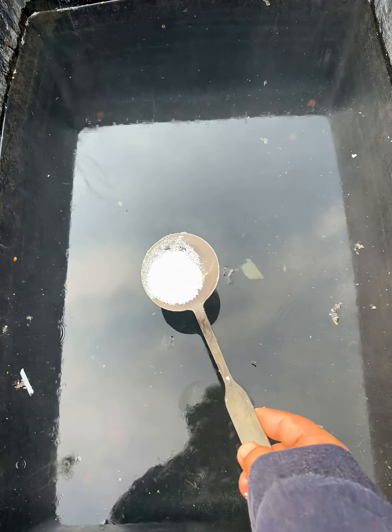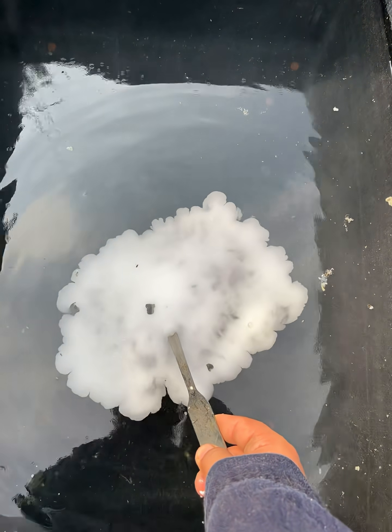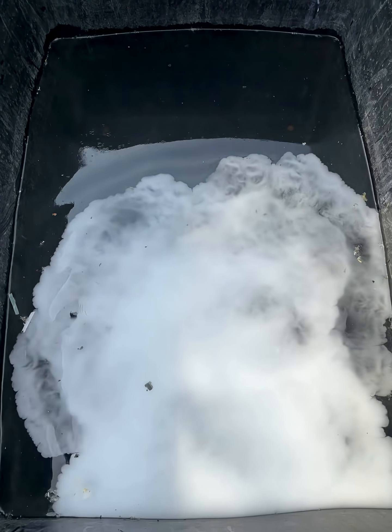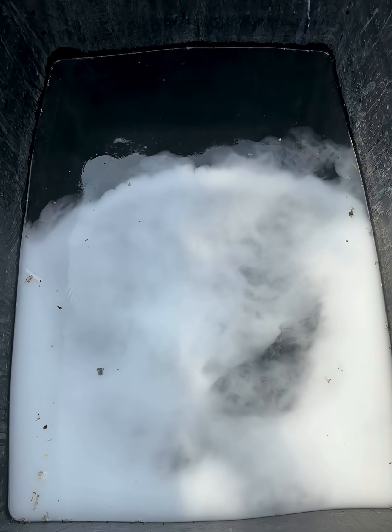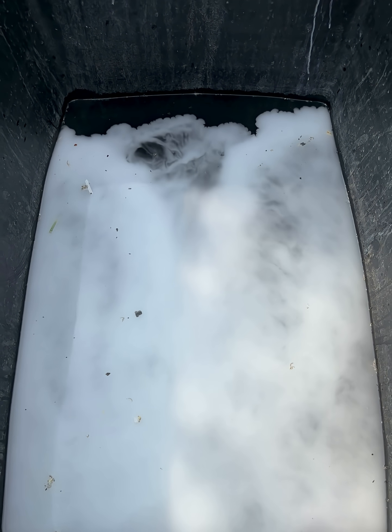This is a little bit of water. Let's see — oh, look at that! Beautiful! Look at this beautiful color — that's amazing! It has produced fumes as well. Oh, it went pretty quickly. Those fumes are of hydrogen gas.